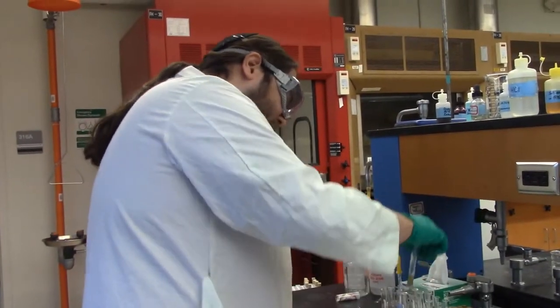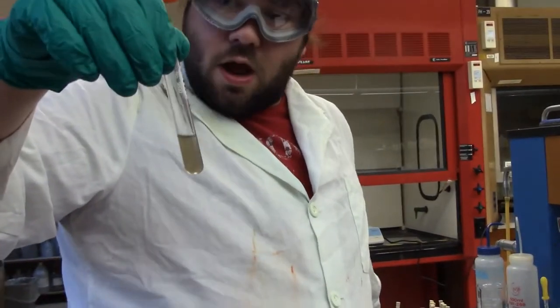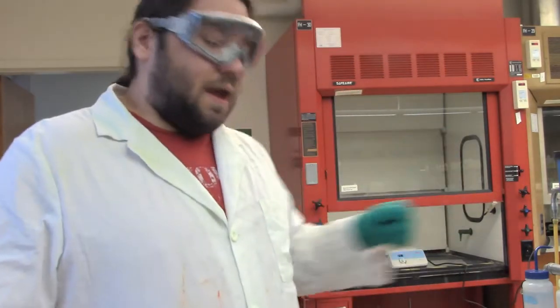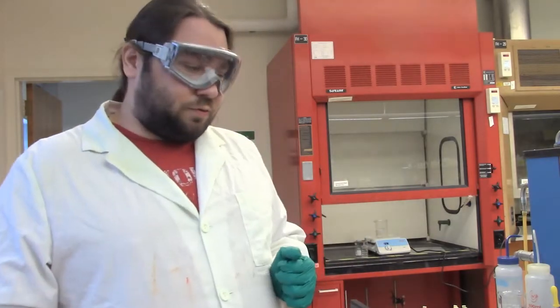And on the other end, we have our supernatant, which has our group 3s and our group 4s. As we go through this, I'm going to try and be as unemotional as possible. I don't want to give you hints that will imply that something's there or not, but the one hint I will give you is that we do have at least one cation from each of the groups. So we have at least one group 2, at least one group 3, and at least one group 4. So we do need to test both the precipitate, our group 2s, and the supernatant, our group 3s and 4s. So to start with, I'm going to do the group 2s, and then we'll cycle back around and do the group 3s and 4s later.